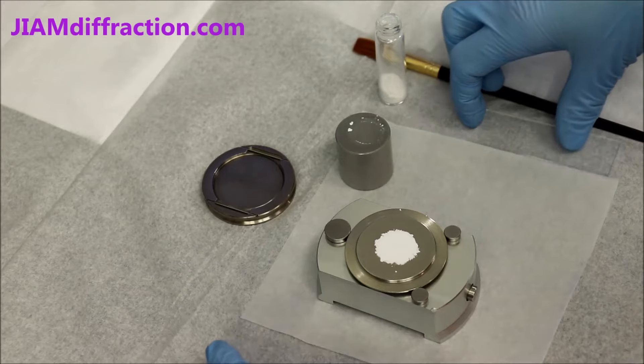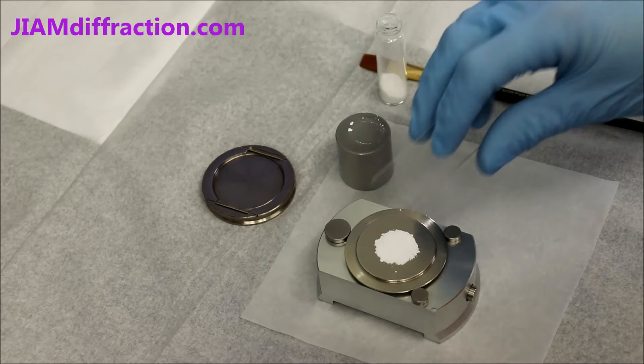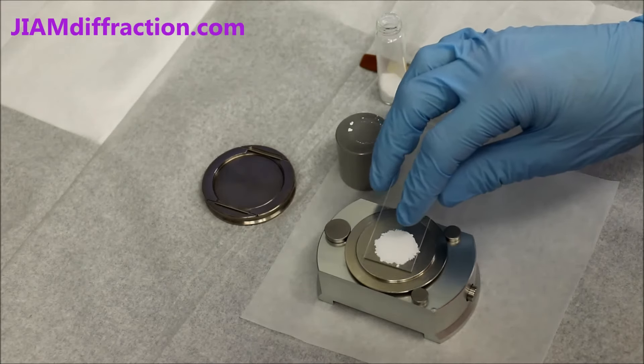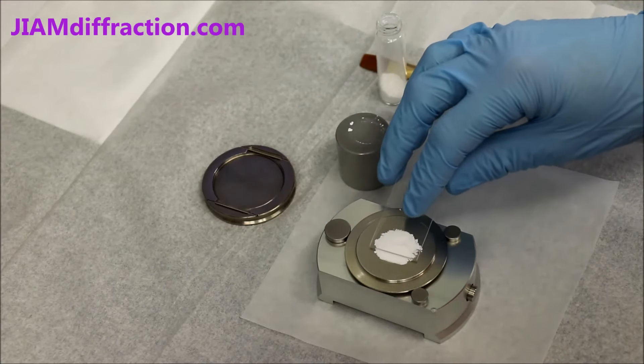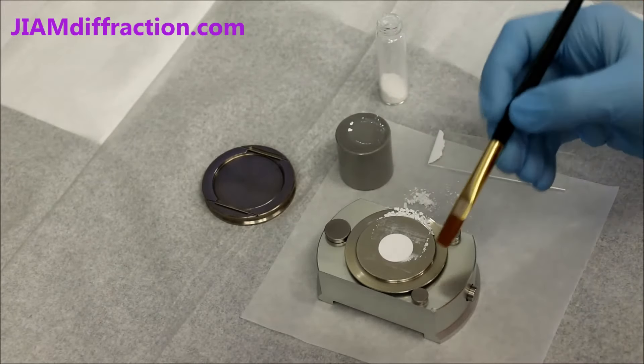Now we do have some extra powder, so we will remove it. You can use either a glass slide or a razor blade, whatever's handy. And that's pretty good, you can then remove the rest of it with a paintbrush.